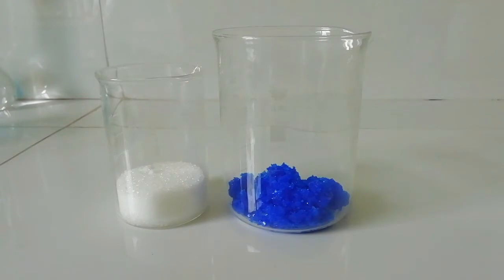This is because if we use an extra amount of citrate, that will dissolve our final product copper citrate as a complex.